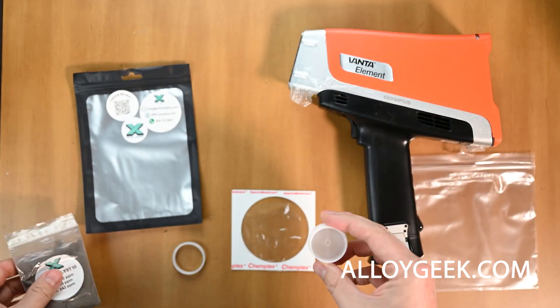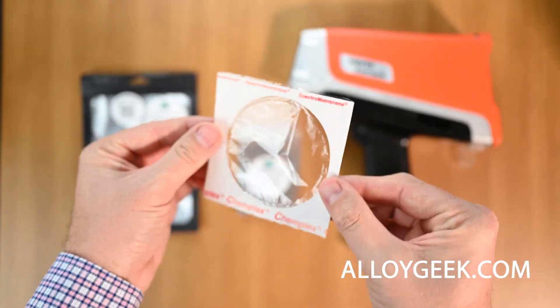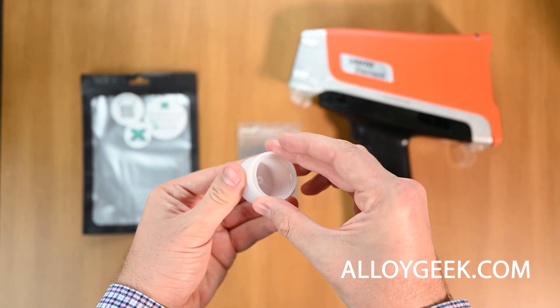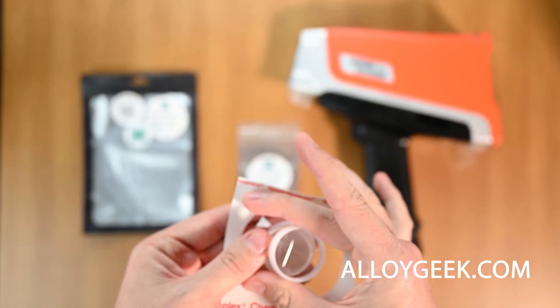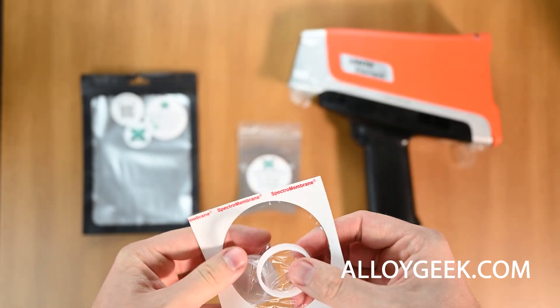Now, you're going to have to get messy to do this, and that's okay. Then we're going to take a thin film like this one — this is an XRF film, a specialty film designed for use in this application. We're going to need to put that on the cup with this little ring that holds it in place. You'll see it's hard to do, and it's going to take you a couple of times to get the hang of how to do it. If it wrinkles like this one, just try again.